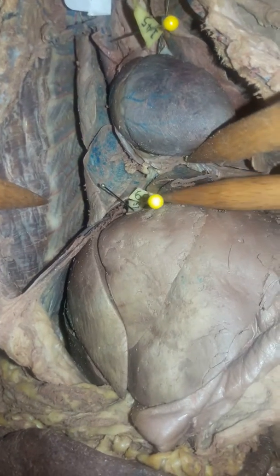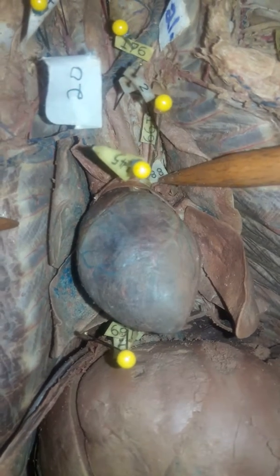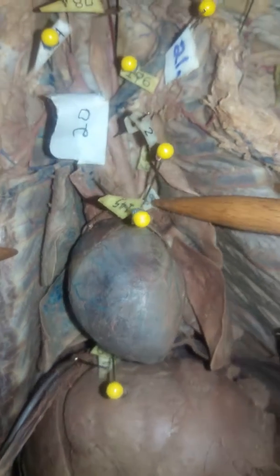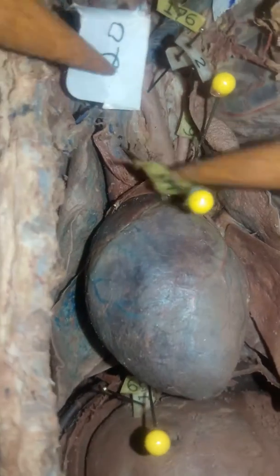Moving on up, 169, where you see there is going to be inferior vena cava. 15 right here on top of what looks like the liver is going to be the hepatic vein. And we're moving on up to right here. 88 is our aortic arch, where we're going to have branches coming off of that. 145 here, this blue thing right here, big superior vena cava.